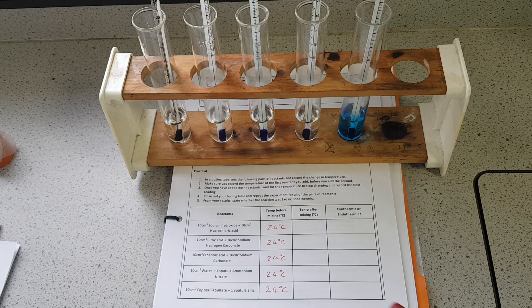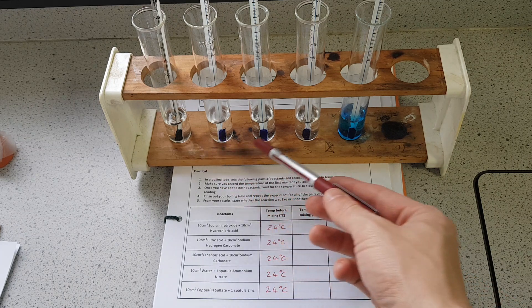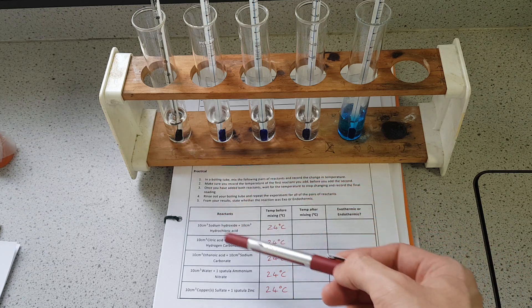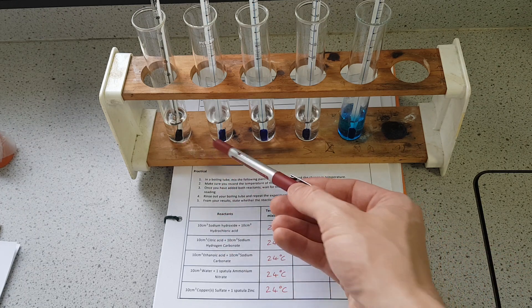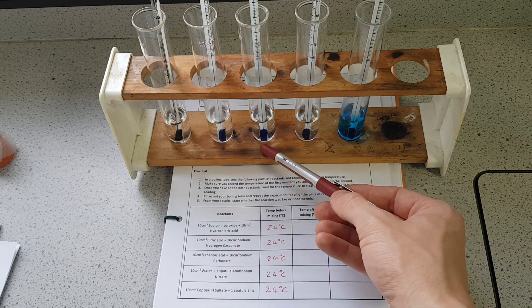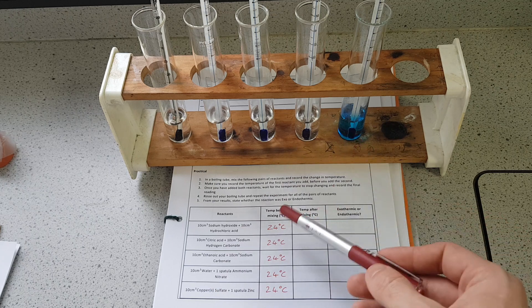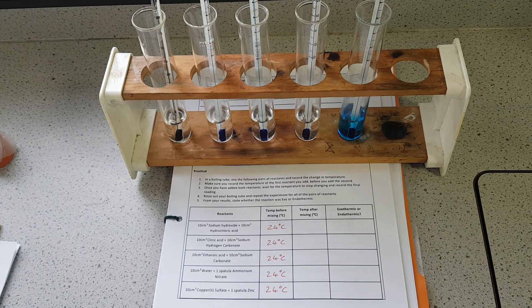I've already measured the starting temperature of all of these different reactions. I've got sodium hydroxide in here and measured the temperature, citric acid in here, ethanoic acid in here, water in here, and copper sulfate in here. As you would expect, the starting temperatures are all the same.